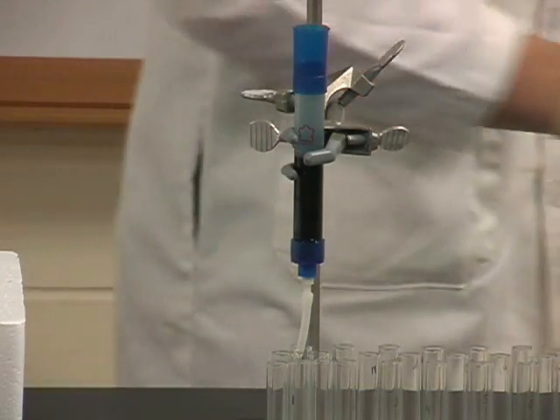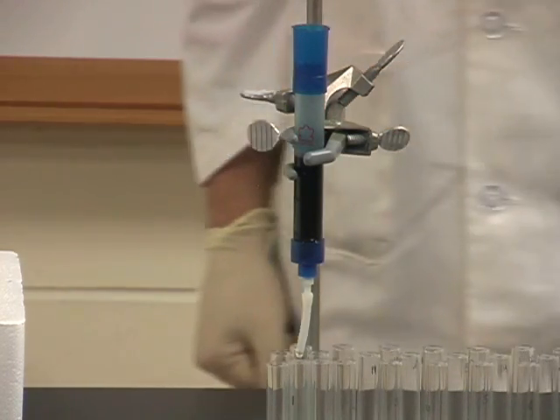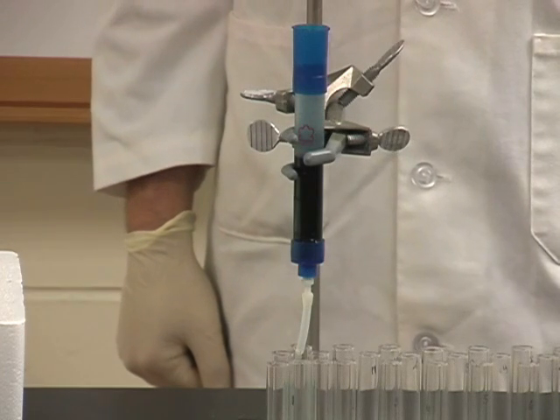You must work quickly in order to keep your sample from warming up too much so it's important to keep the column dripping at all times. This will allow your sample to be pulled through the column, allowing you to work as quickly as possible.